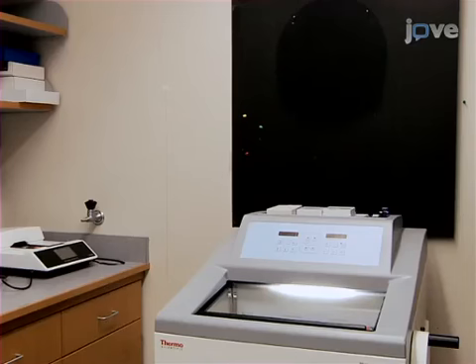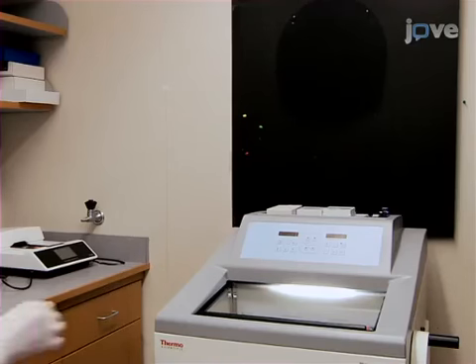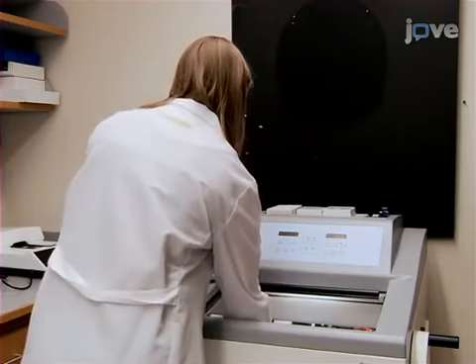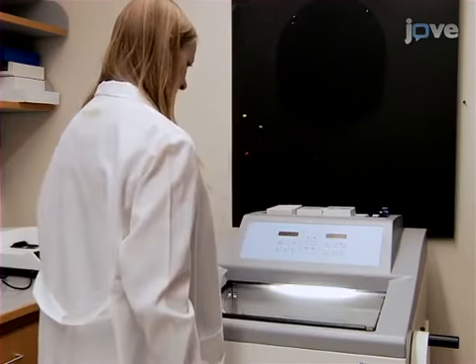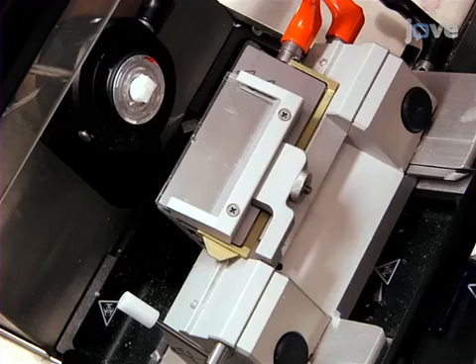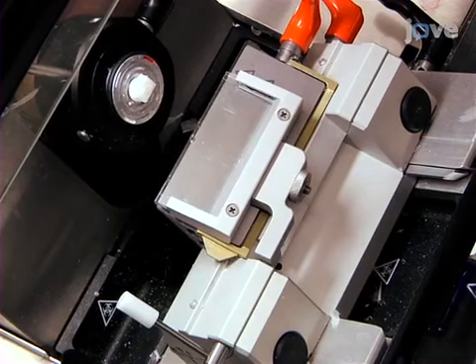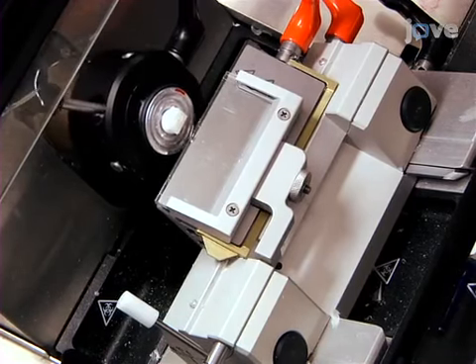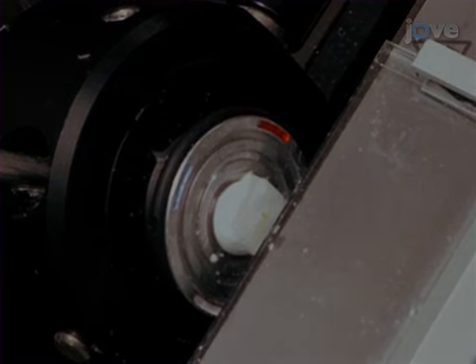Place the cryostat chuck in a cryostat box set to minus 20 degrees Celsius until the OCT solidifies. After allowing the chuck and gelatin to equilibrate in the cryostat box for about 15 minutes, use the cryostat to section the tissue.